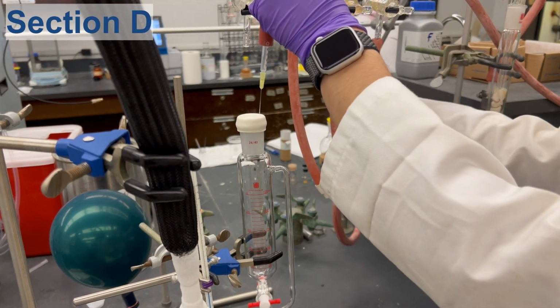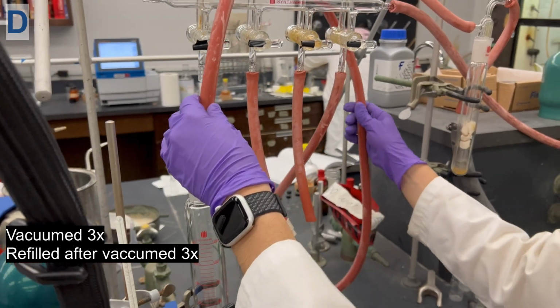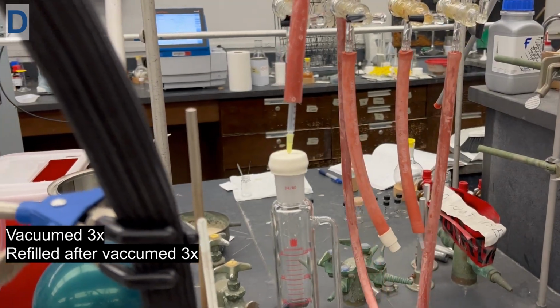At this time, the addition funnel and round bottom flask apparatus are vacuumed down for 5 minutes to remove the air in the system. This is done by turning the black knob downward to vacuum out the air.